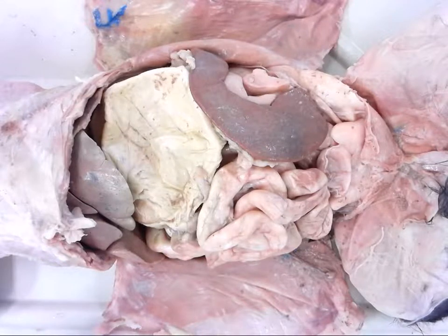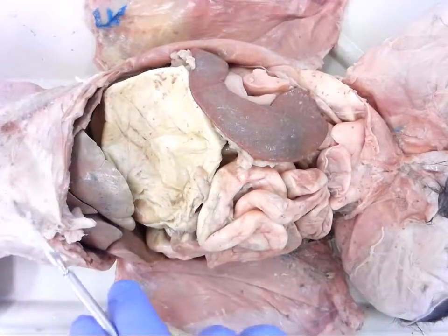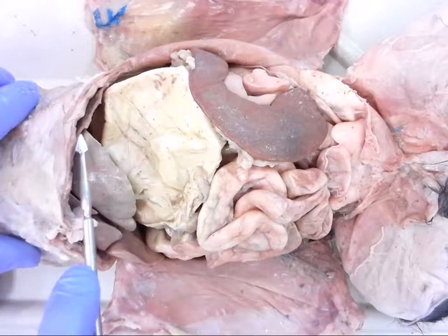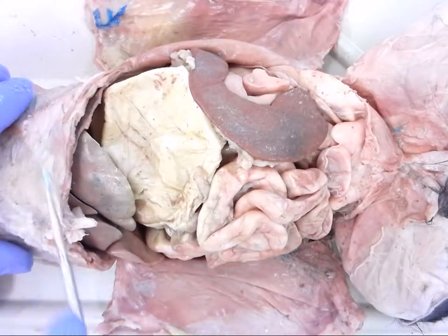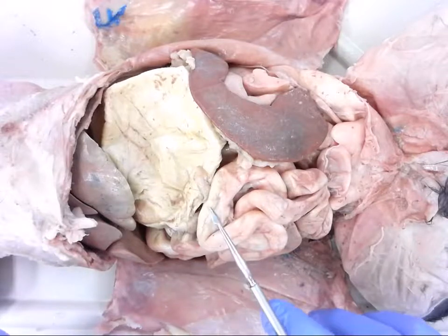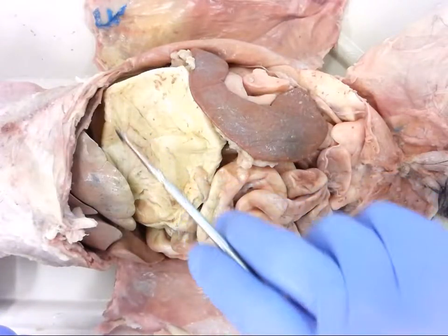The torso is divided into the abdominal cavity, and just above that is the thoracic cavity, divided by the diaphragm — I've cut just a little bit of it right there. This is a fairly thin muscle that we'll see once we get further up into the thoracic cavity. The digestive tract starts with the mouth, and once food is swallowed it works its way down through the esophagus and into the stomach.